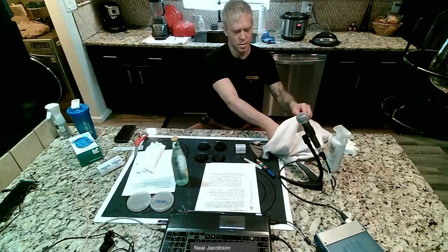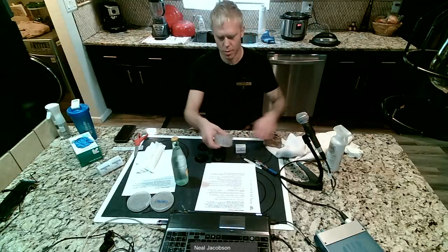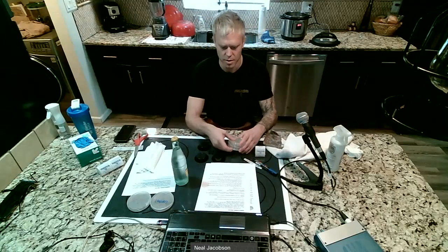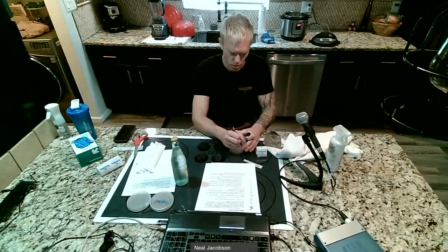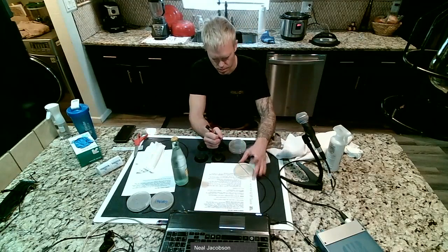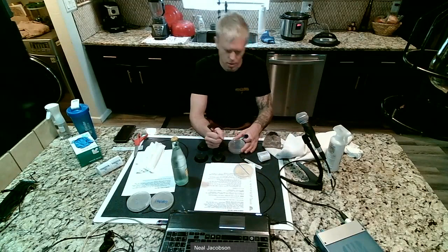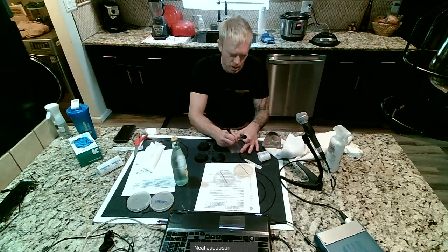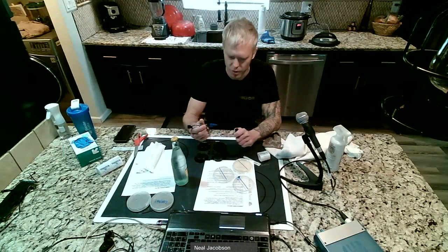We're going to take 3 more plates. And what we're going to do with these plates is flip them upside down and draw a line on the bottom of them. So we're going to cut them all in half. Not like with scissors, but you know. Just going to draw a line down the middle of all 3 of them. Oh geez, I just leaked paint pen all over that one.